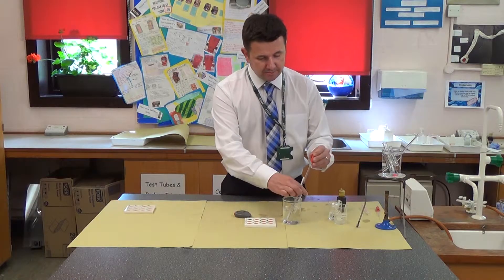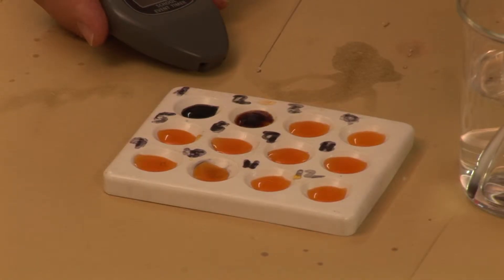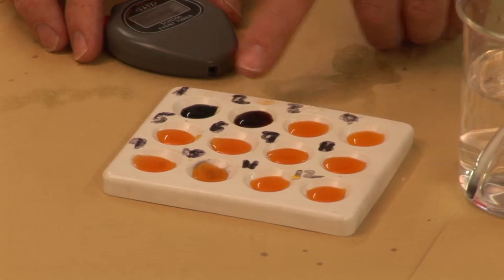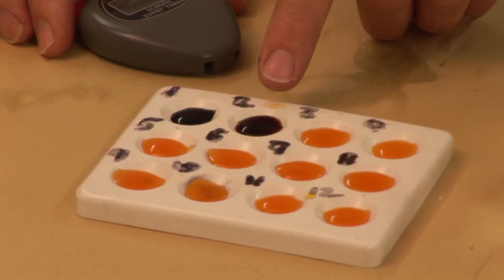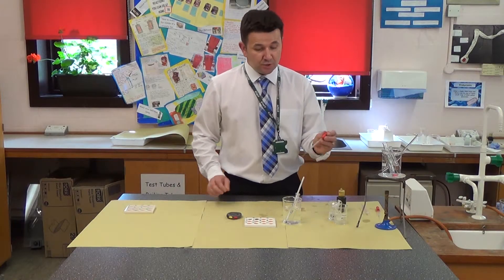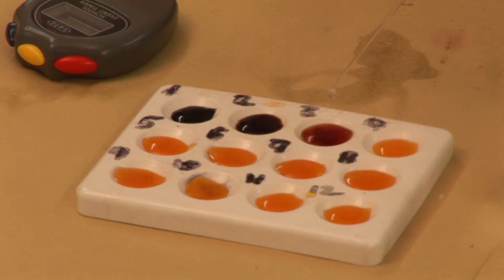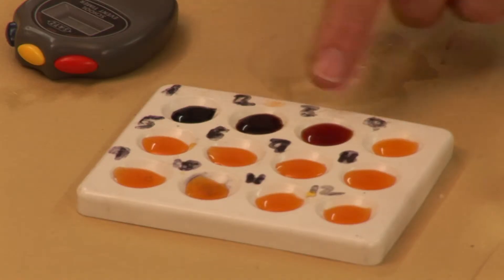After one minute, I take another sample and add it to the spotting tile. You can see that something is happening — it's less black here than it was at the start, showing that the amylase is breaking down the starch into sugars. Remember, iodine only indicates for starch. After two minutes, I take another sample, and you can see there's still a colour change but it's not as dark as before.